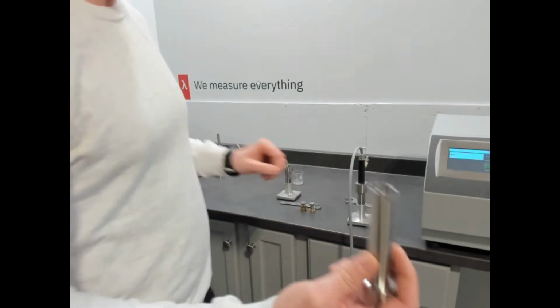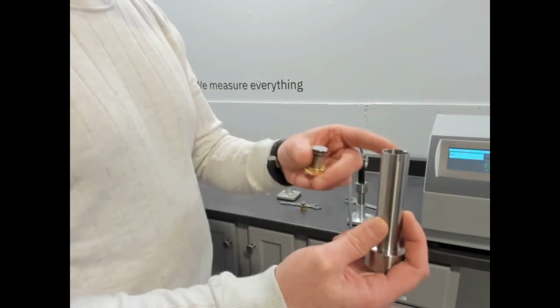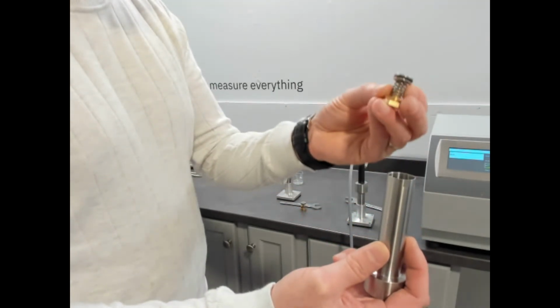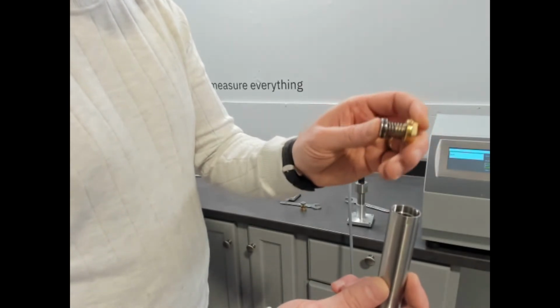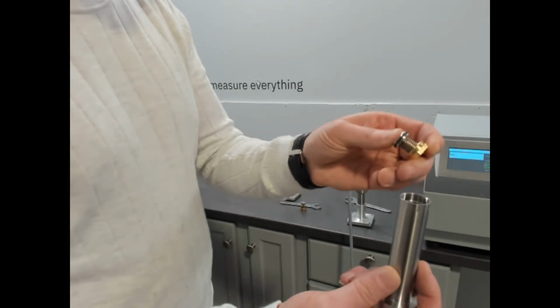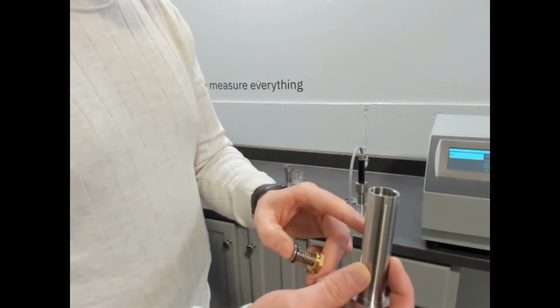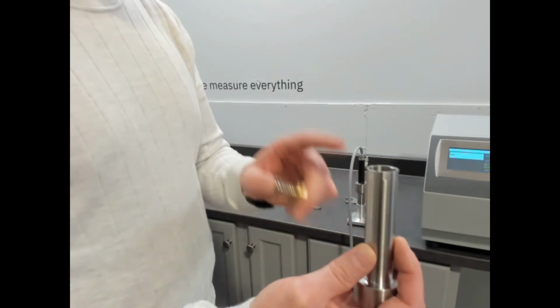If you were measuring phase change materials, you would pour the sample in on a heated side, so it's in the liquid phase. And this is the plunger bottom that we use. This plunger bottom, as you can see, allows for about 15% change in volume. The key there is that as the sample changes in volume, it maintains contact with the wire.